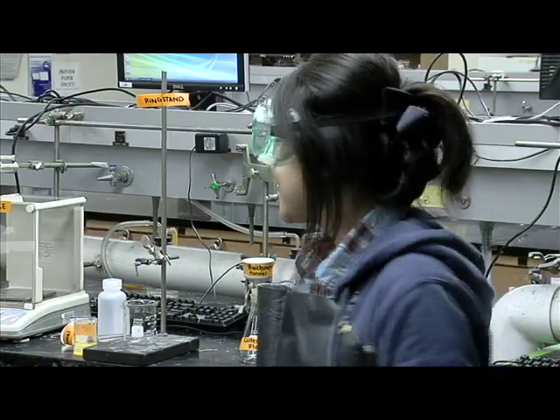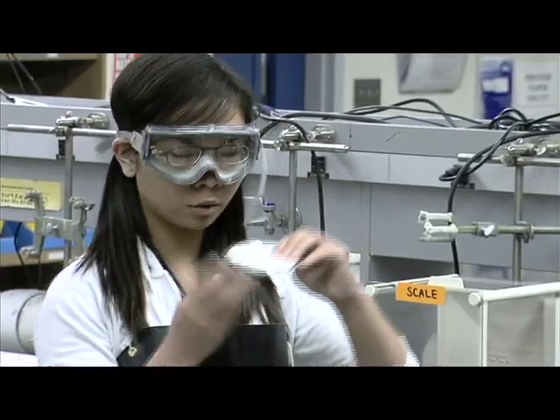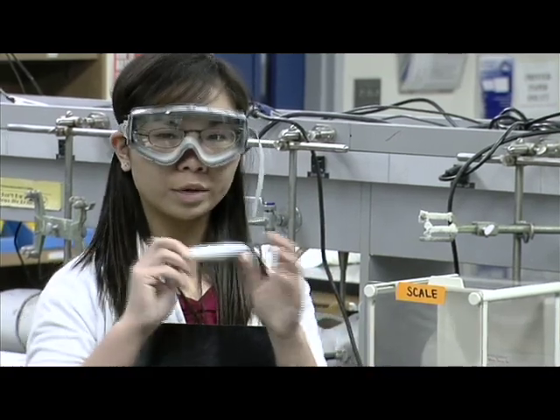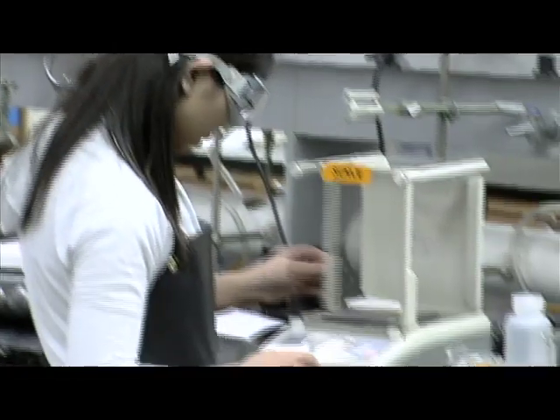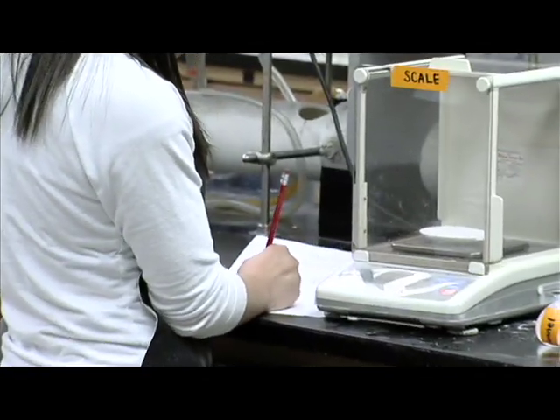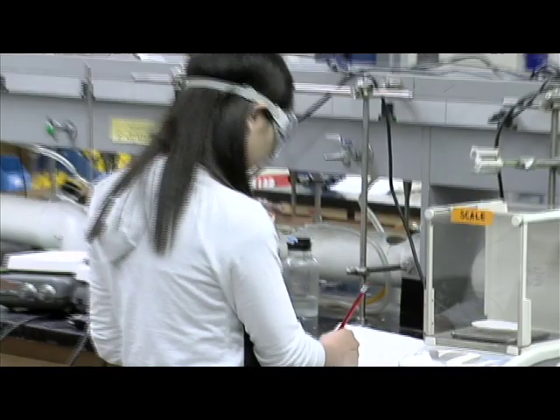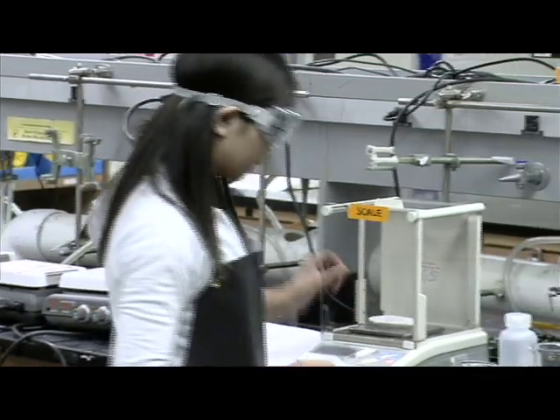Now we're going to demonstrate gravity filtration. For gravity filtration, we're going to weigh the precipitate on the filter paper on the watch glass. First, we have to weigh this alone. After we weigh it, we record this as the initial mass, and we're going to record the scale number, then go back and use the same scale for accuracy.